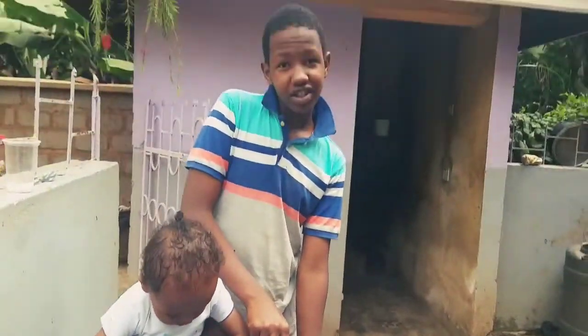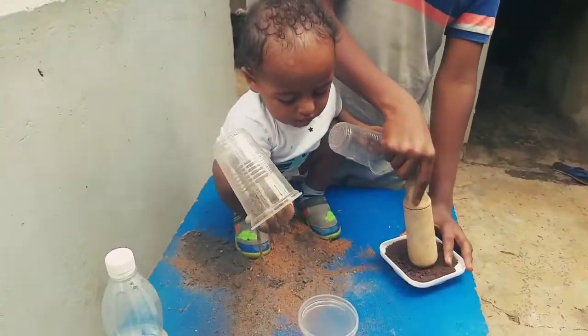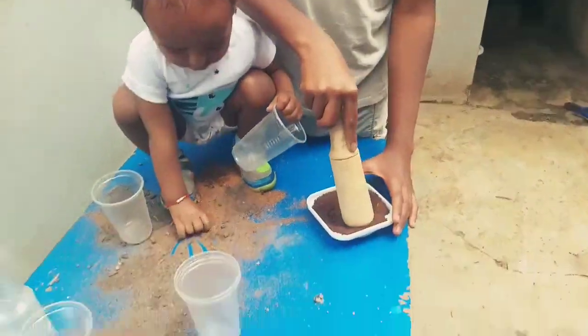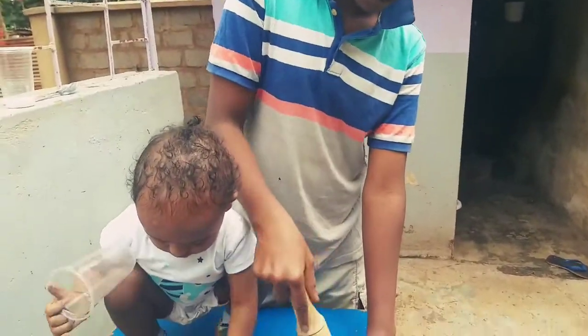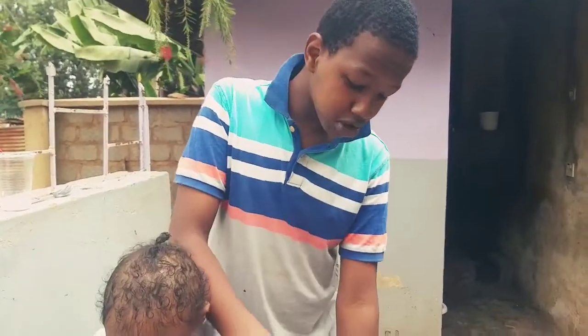So what's going on now? You're grinding the soil to make it fine. Why do we need to grind it? Just to make it fine so that it does not disturb us during the experiment.